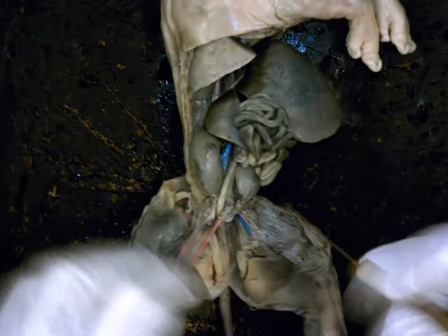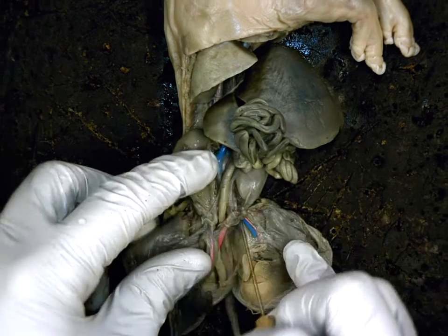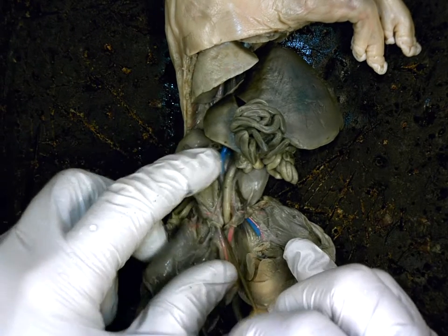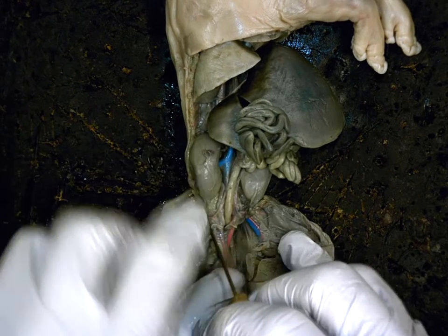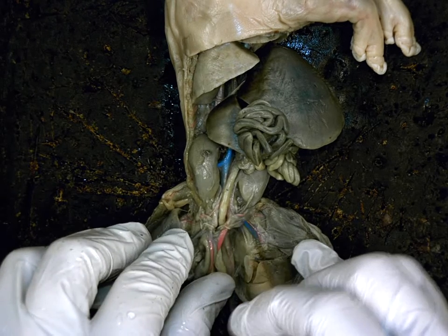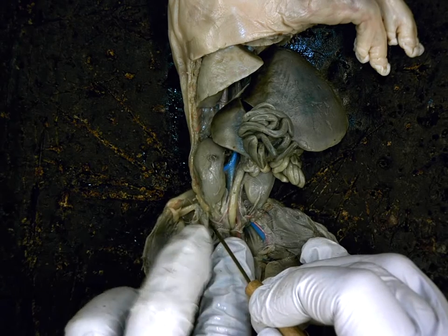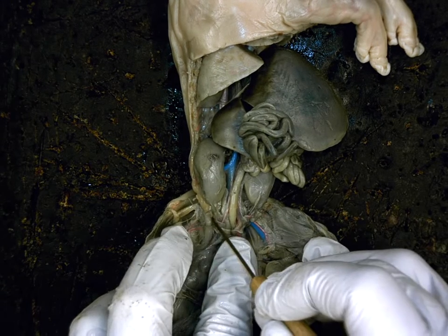Okay, for the female reproductive system, what you first need to find is she has two little round structures sitting in the lower part of her coelom. One little round one, another little round one. What is this? It begins her reproductive system. Her ovaries. Function of them, two things.